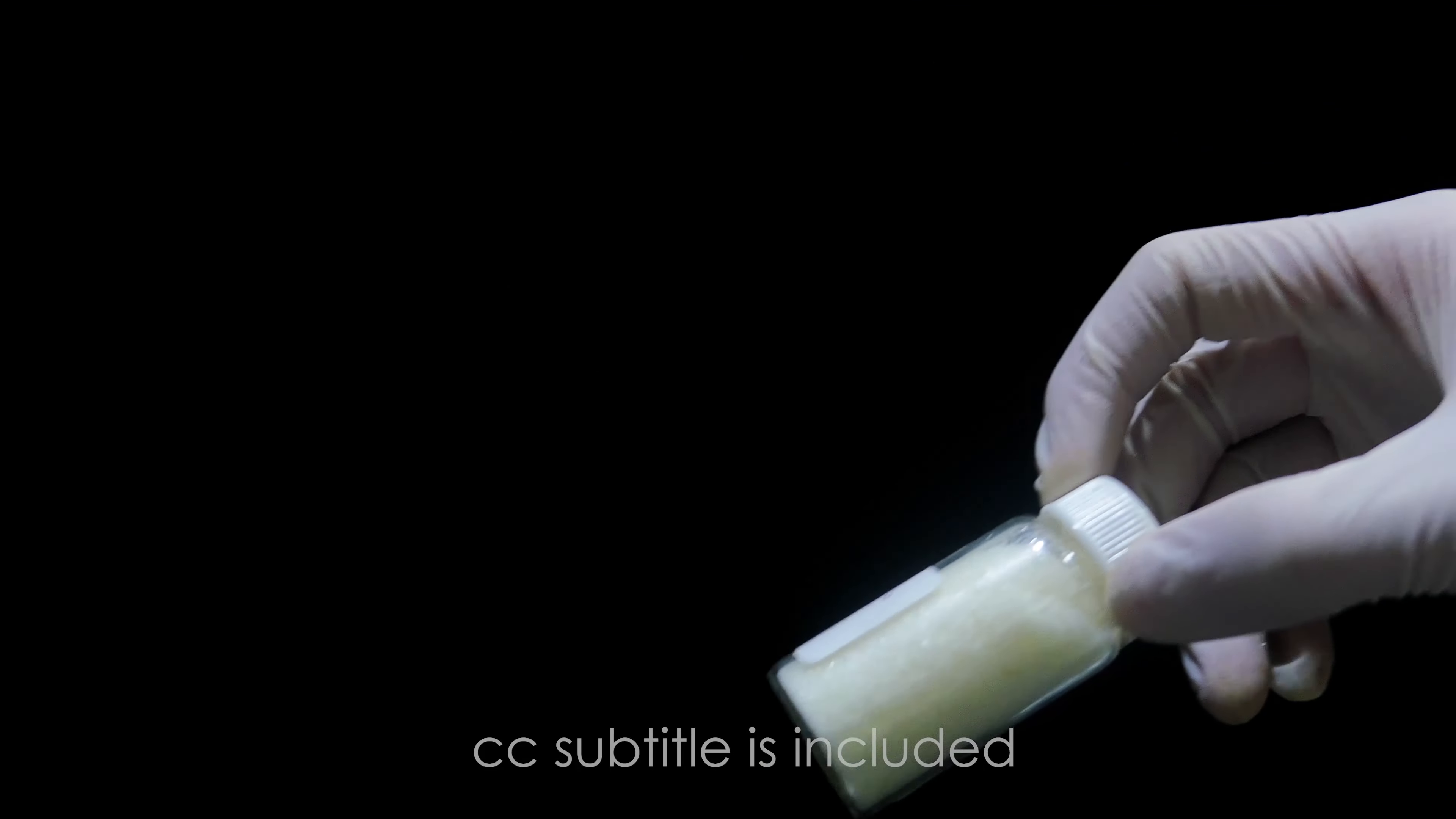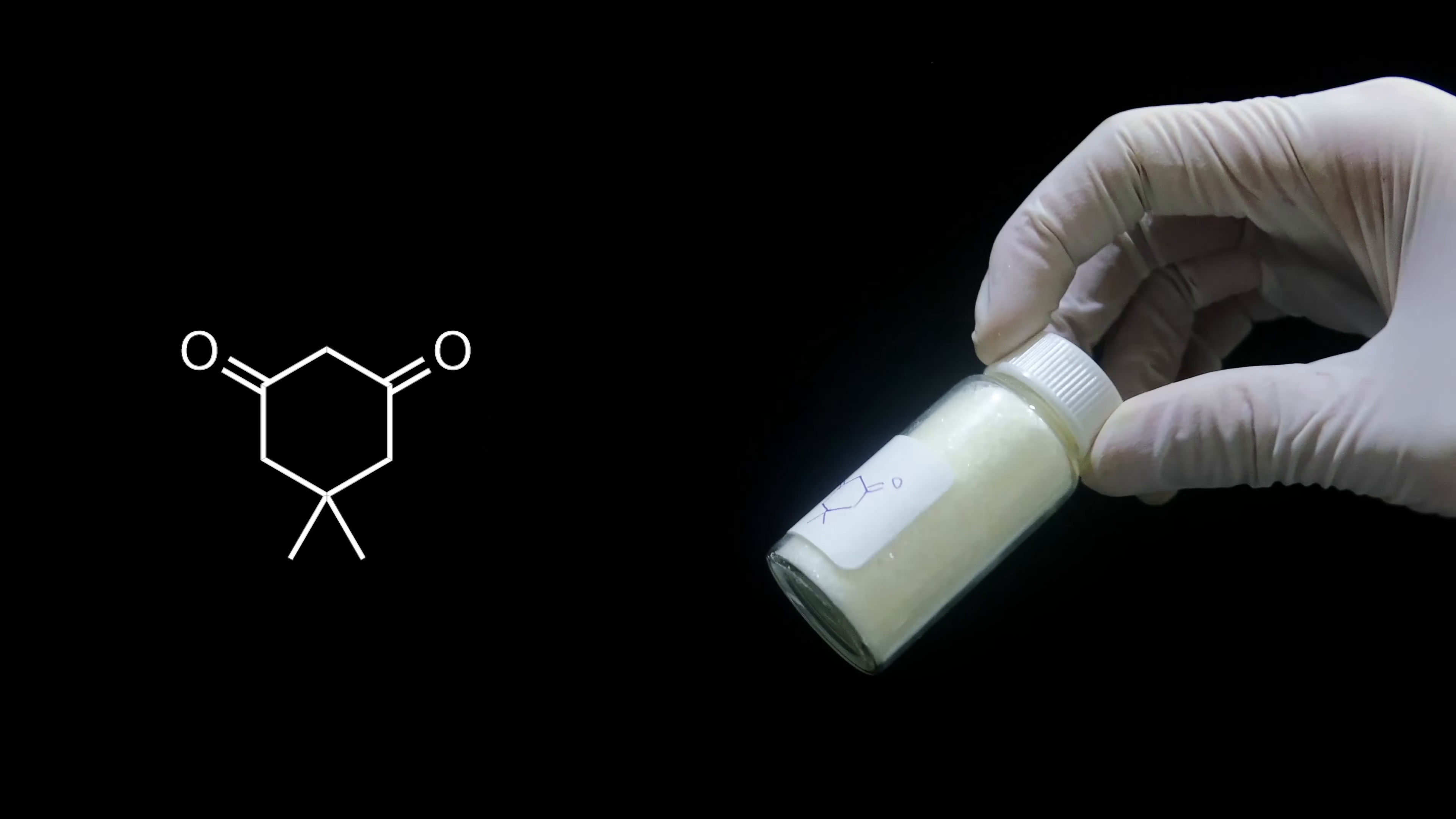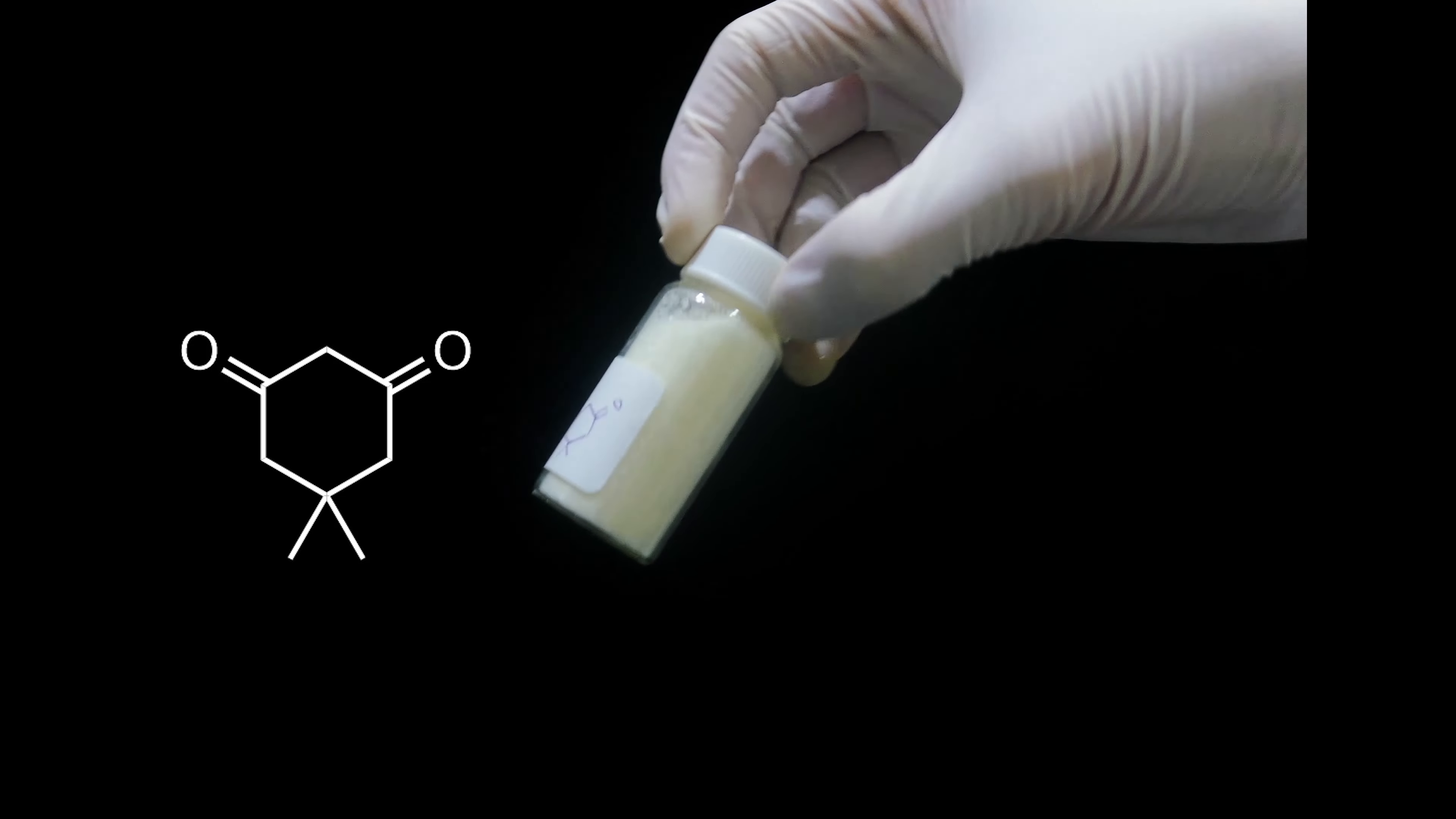In today's video, I'm going to synthesize some dimedone, which is a simple cyclic diketone compound. The reason for making this compound is because it involves some intriguing synthesis strategies. Additionally, I'm planning to make some metal complexes with dimedone.